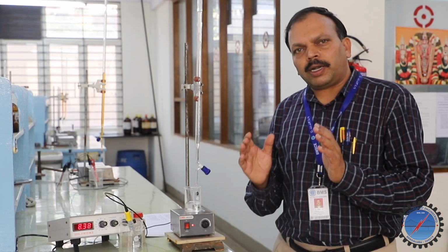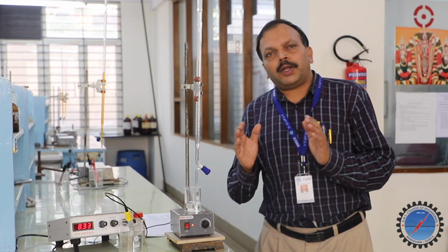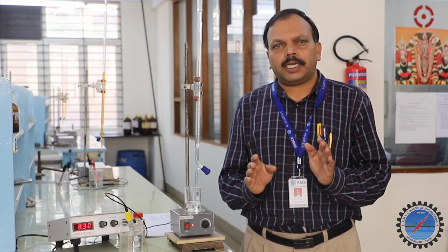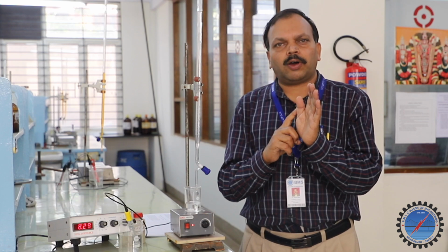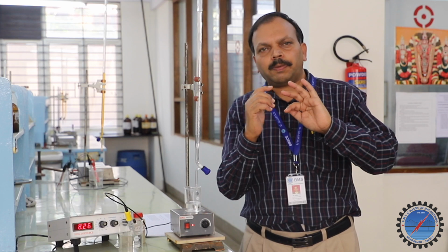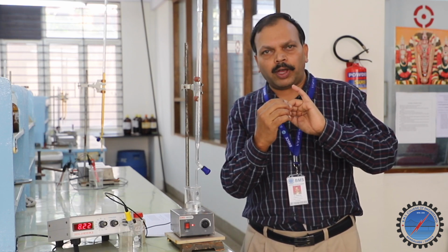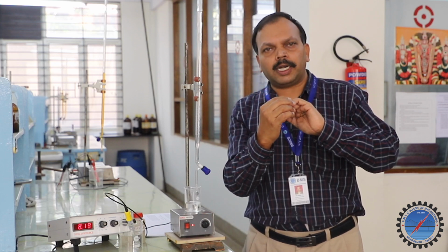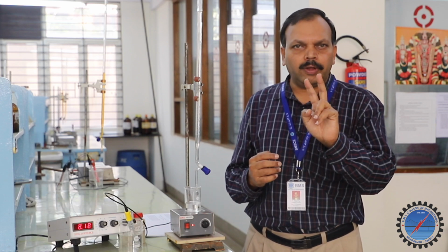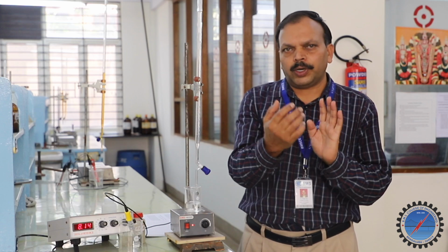The concept of the Henderson-Hasselbalch equation we use here is that we are going to plot 2 graphs from the tabulated result I already mentioned: the volume of NaOH in the first column, pH variation in the second column, delta pH, this reading minus the previous reading, in the third column, delta V, which is the fixed 0.5 ml, and the last column, delta pH by delta V. With this 5-column tabulated result, we are going to plot 2 graphs. The first graph, I am going to show along with this result, substituted in this video.